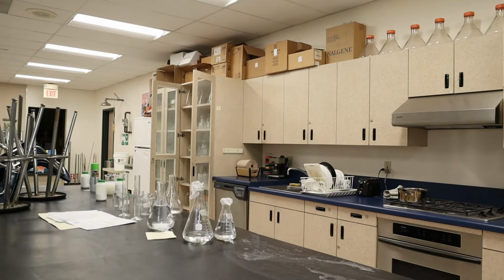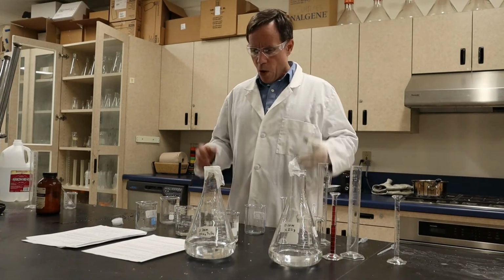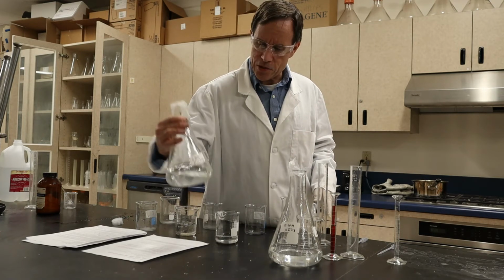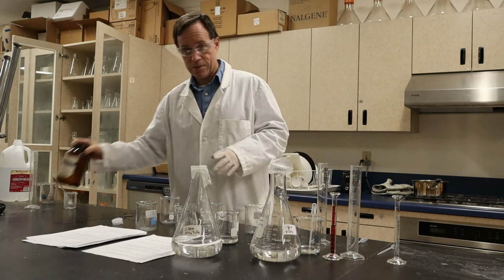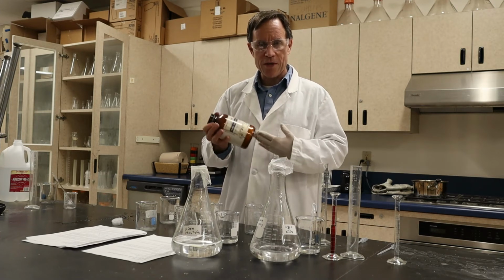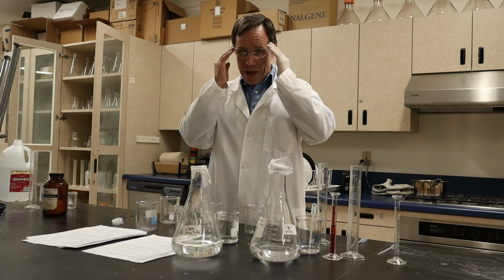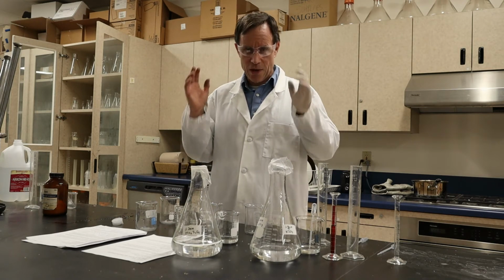So first we need to make our solutions. All right, let's do it. All right, so looks like I'm almost ready to do the demonstration. I've got everything I need here. I've got my sodium metabisulfite, I've got my potassium iodate, and of course I've got my starch here, one of the most important components. Remember, starch is going to react with the I2, the iodine. Of course, I've got my handy dandy safety goggles. Don't forget to be wearing your goggles while you're doing any sort of demonstration or lab or experiment.